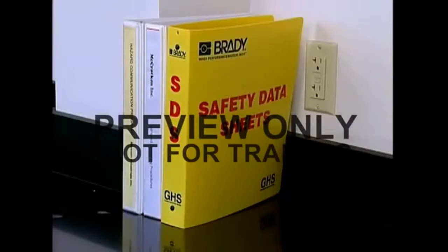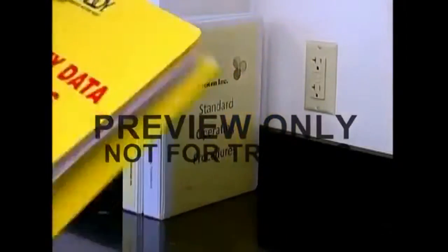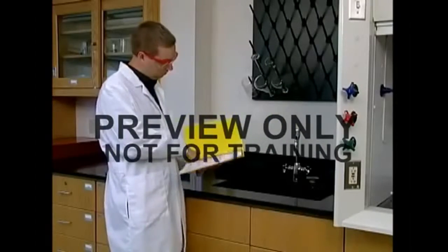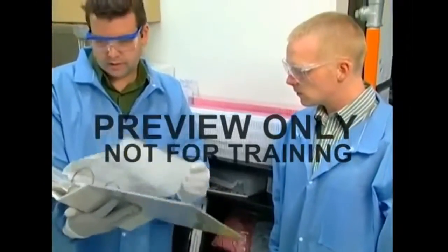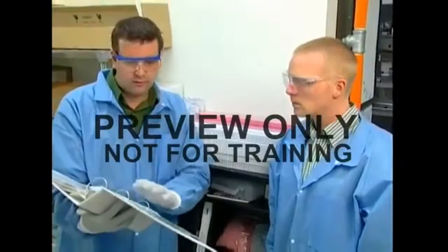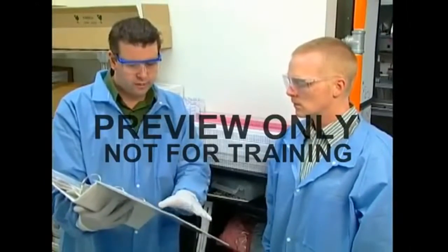You should also read the substance's safety data sheets. These will tell you each substance's ingredients, properties, and hazards. Your facility's chemical hygiene plan will often provide additional information on the safe use of the chemicals.